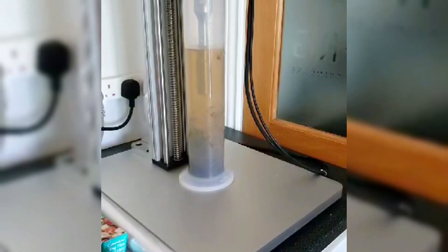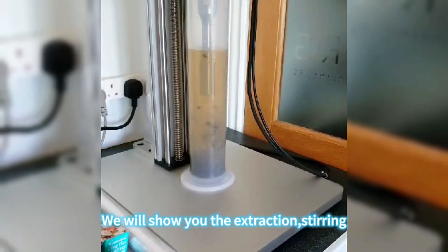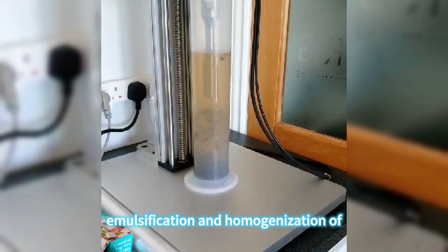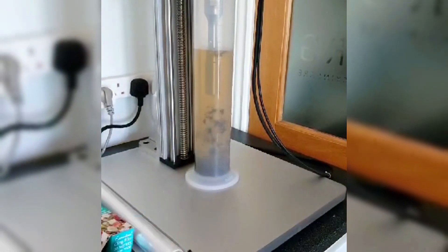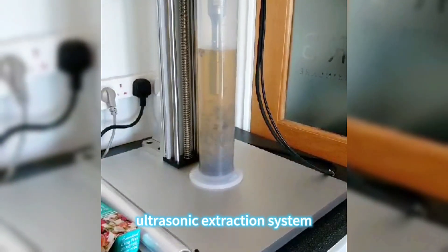Hello everyone, we will show you the extraction, stirring, emulsification and homogenization of ultrasonic extraction system.